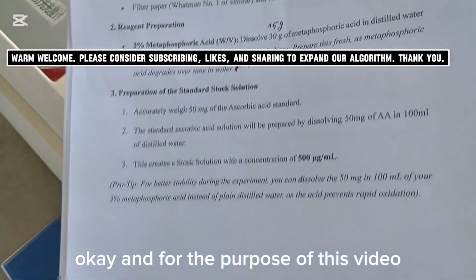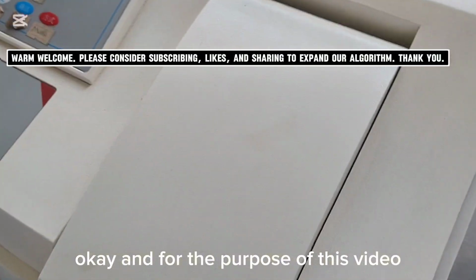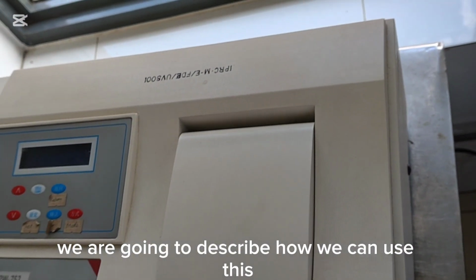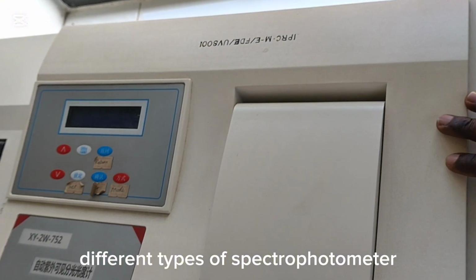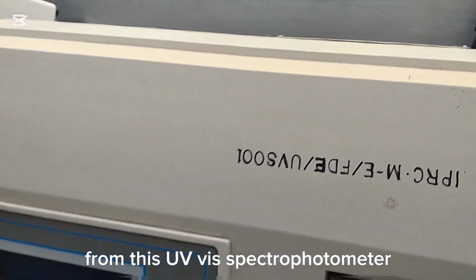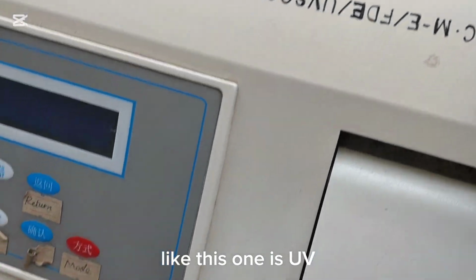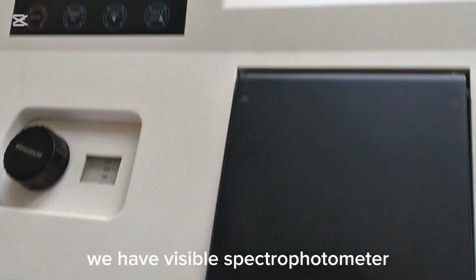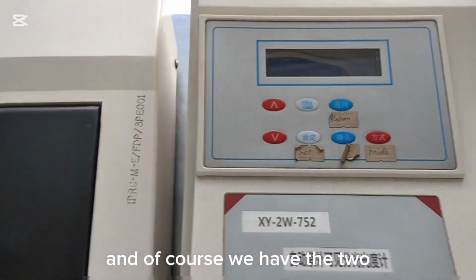And for the purpose of this video, we are going to describe how we can use these different types of spectrophotometer. This one is a UV spectrophotometer. We have a visible spectrophotometer, and of course we have the two.